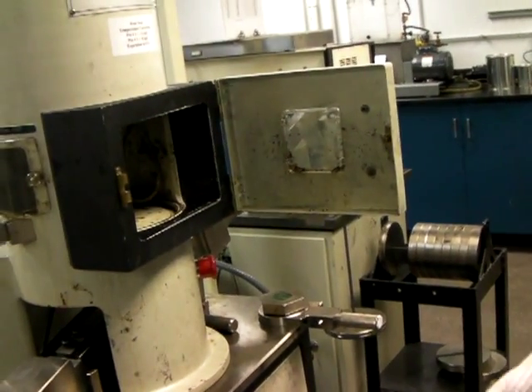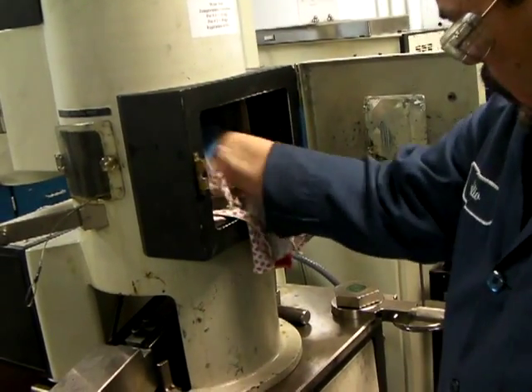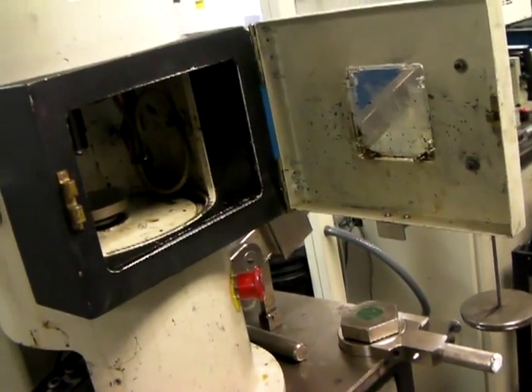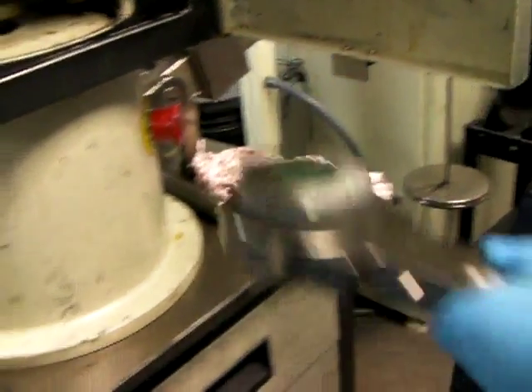Before you start it up, I'll just take a look in there as best I can. You can see the chuck sticking down — that's the ball that does the rotating. And the force comes from below. This cup here gets forced up against the ball.